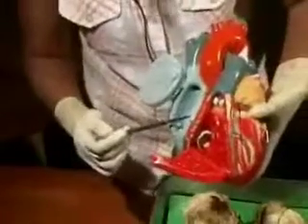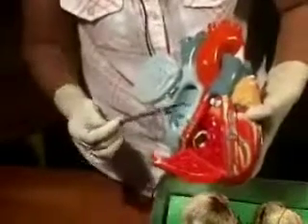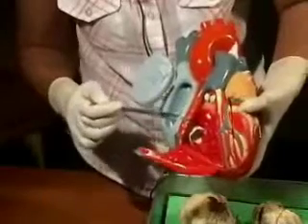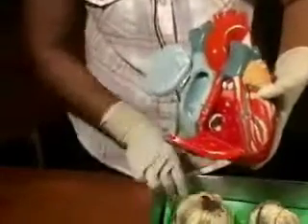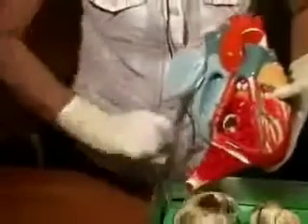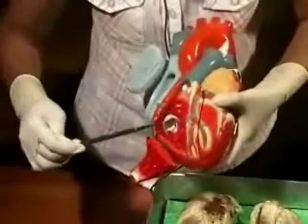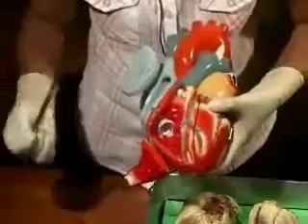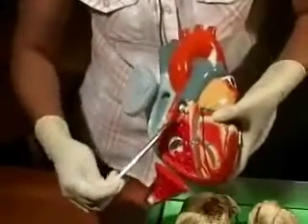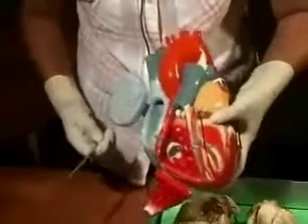And in the right atrial wall, the wall which separates it from the left atrium, which is called the interatrial septum, you have a depression which is known as the fossa ovalis. Now this is the right ventricle, where you see the atrioventricular opening. These are the cusps. It's a tricuspid valve which guards it. And then this is the exit out of the right ventricle going into the pulmonary trunk. It's shown in blue even though it's an artery because it's carrying deoxygenated blood.